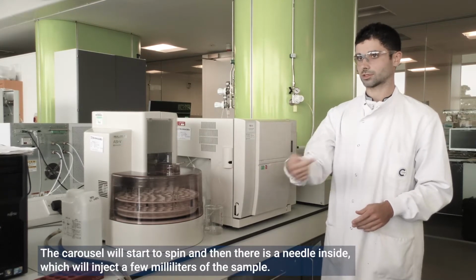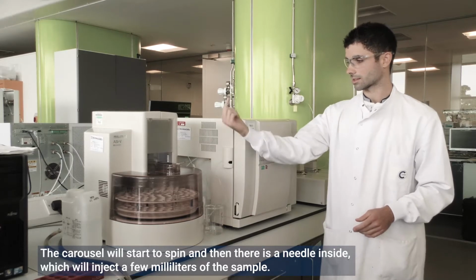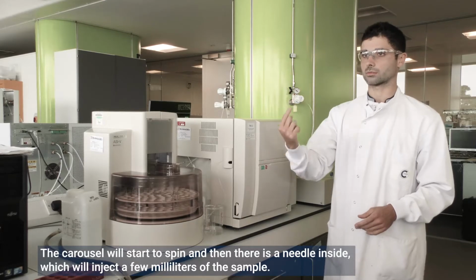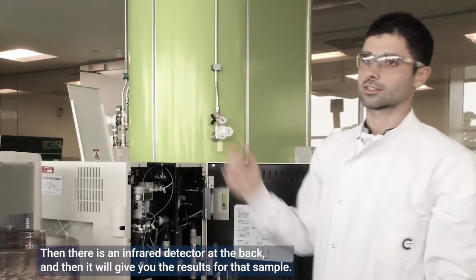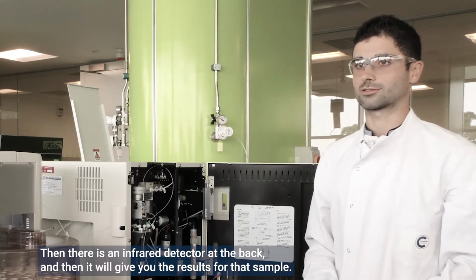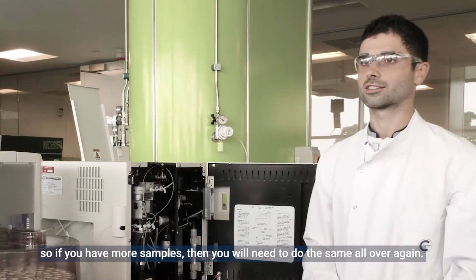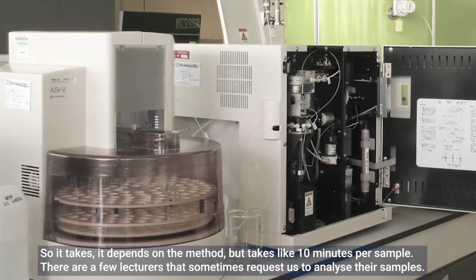The carousel will start to spin, and then there is a needle inside which will inject a few milliliters of the sample, and then there is an infrared detector at the back, and then it will give you the result for that sample. If you have more samples, then it will do the same all over again. It depends on the method, but it takes about 10 minutes per sample maybe.